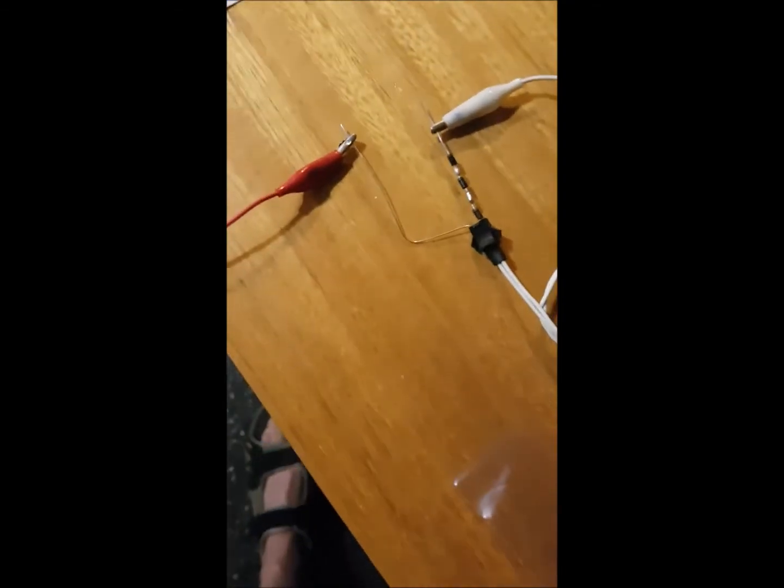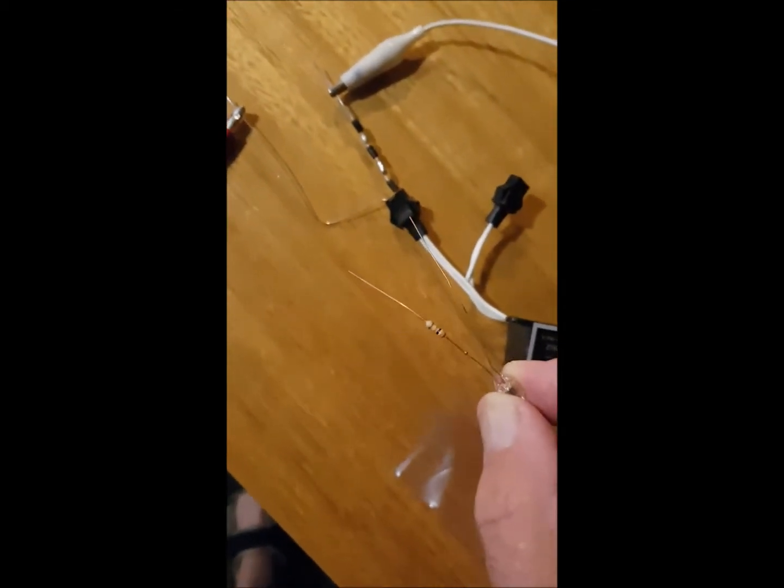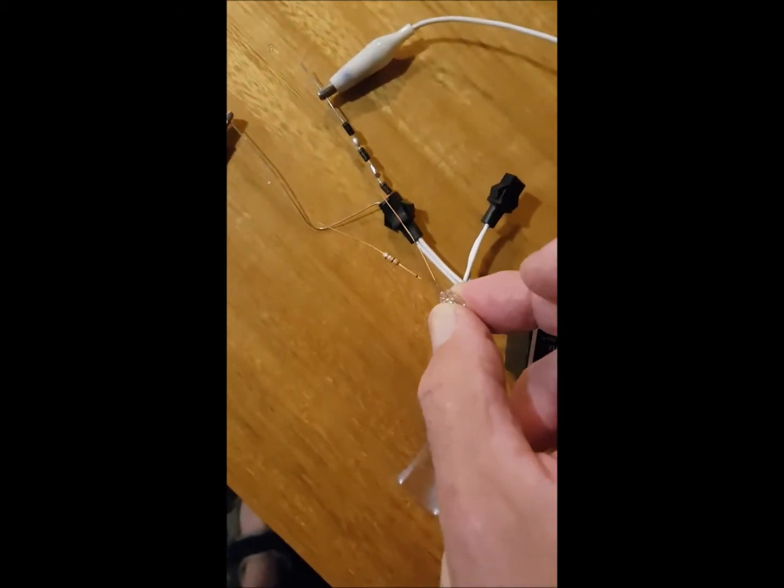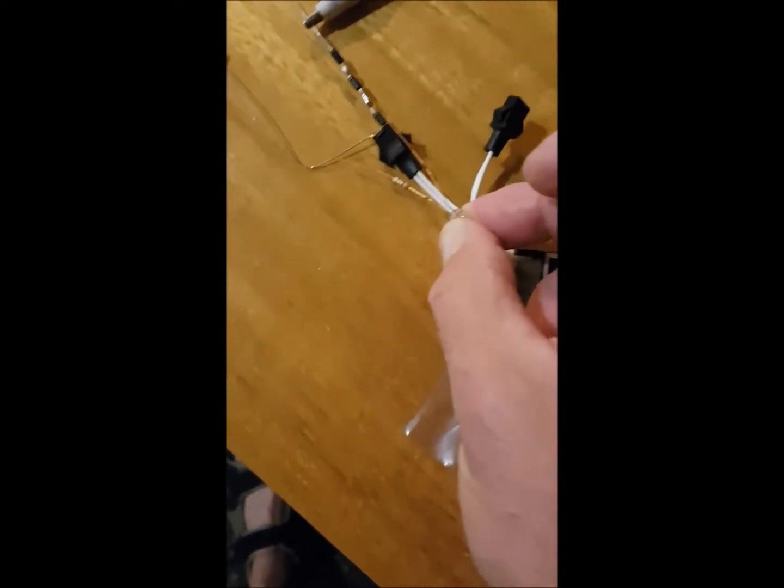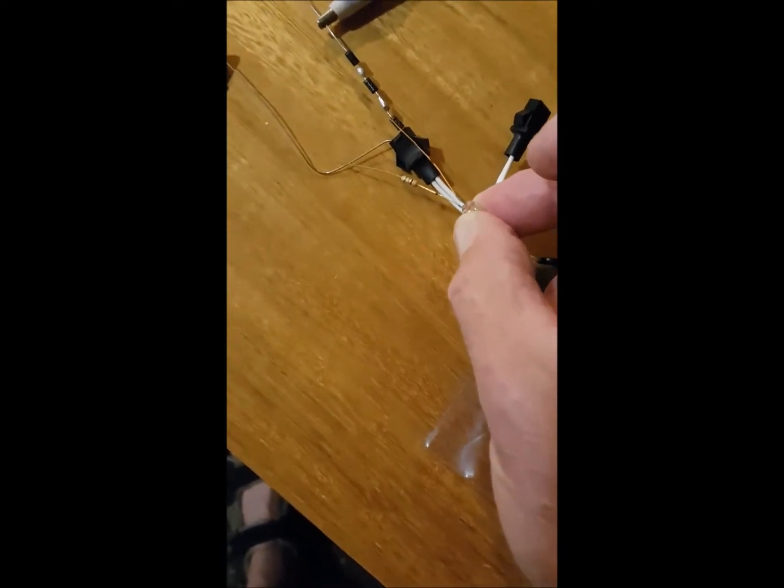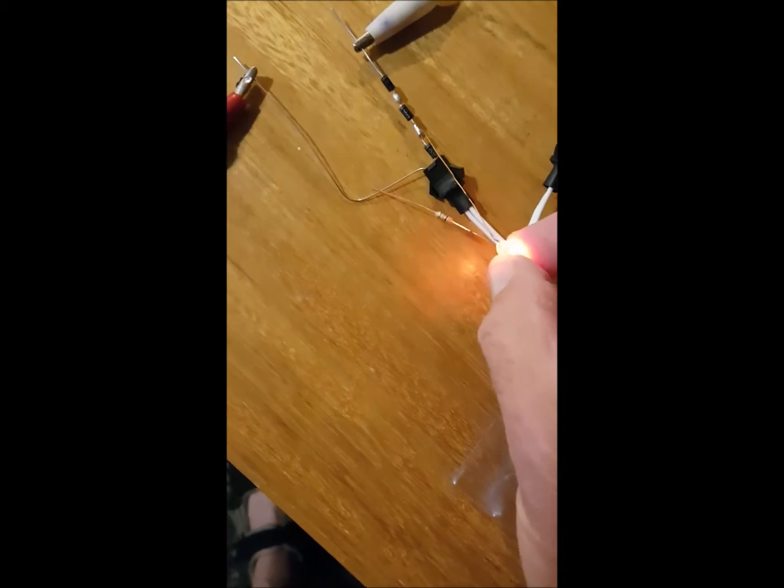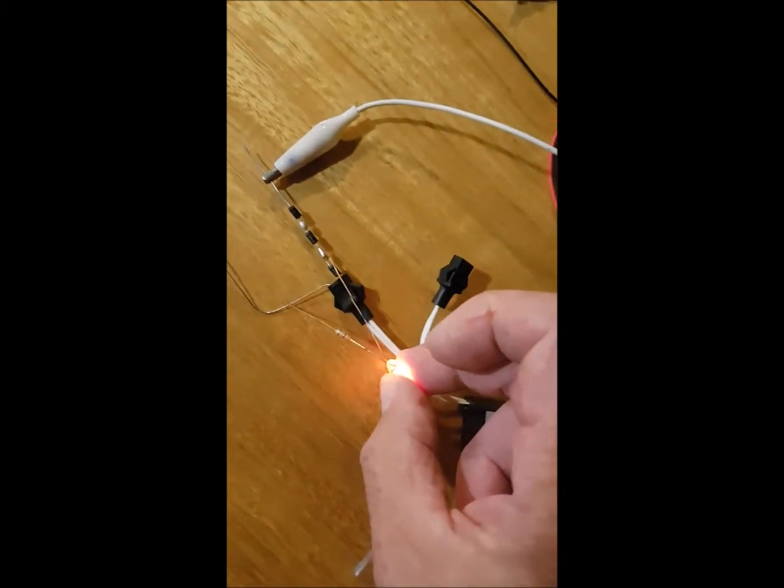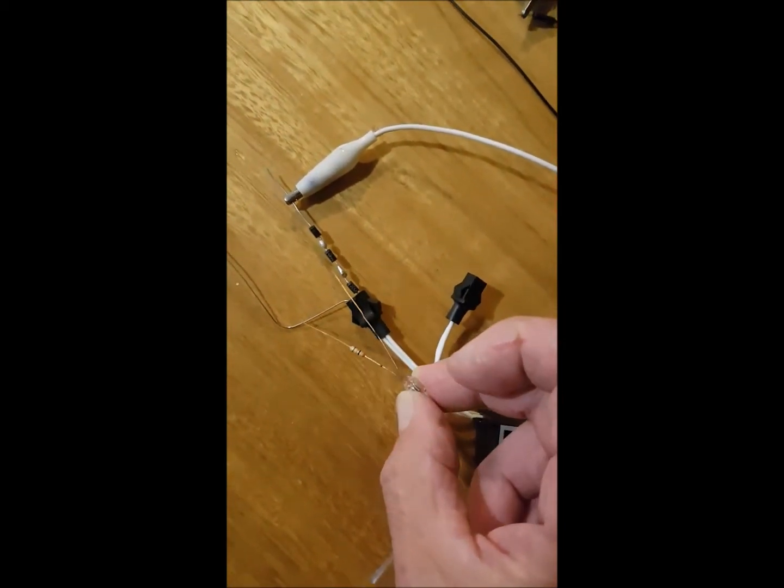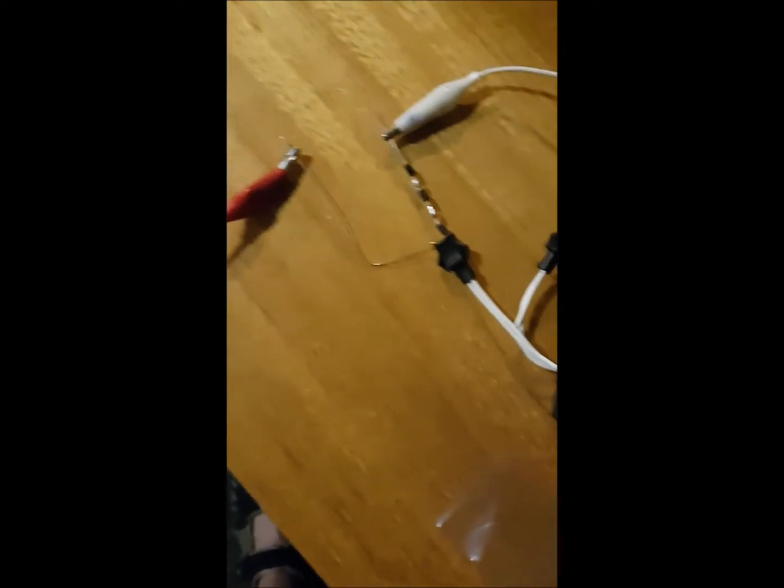Evidence that high voltage is being produced can be seen by this little pigtail neon. It's very hard to do this and photograph. If I touch across there, you can see you've got enough voltage to run a neon that strikes at about 120 volts, or actually with a resistor well above its rated value of 250.